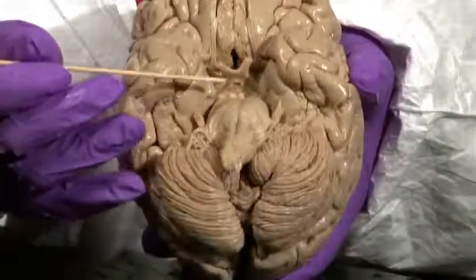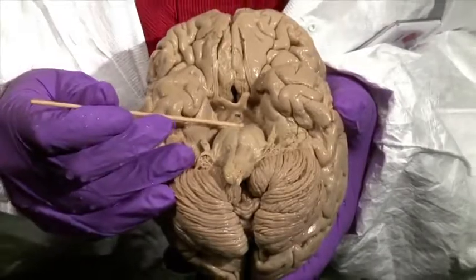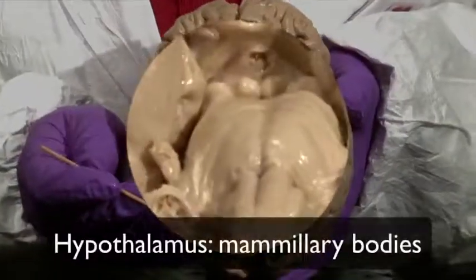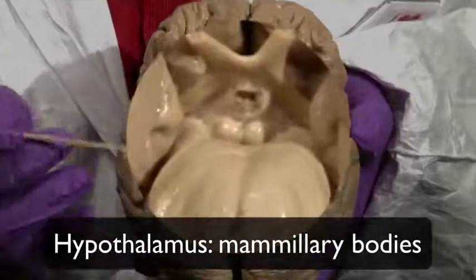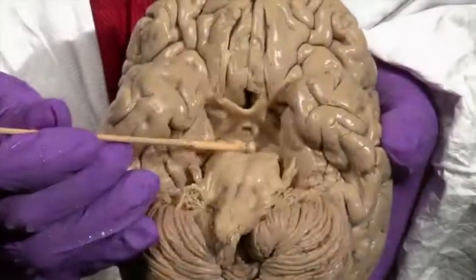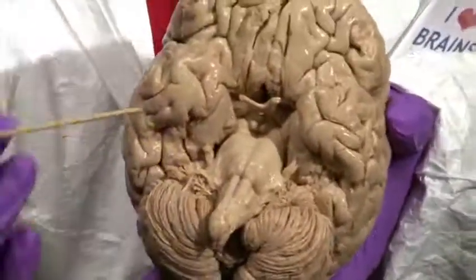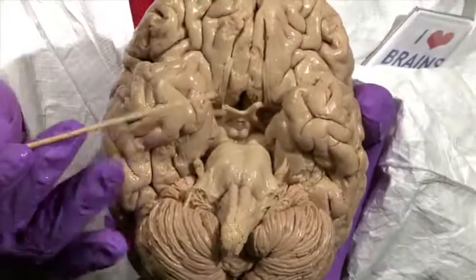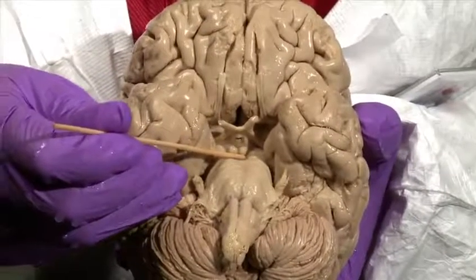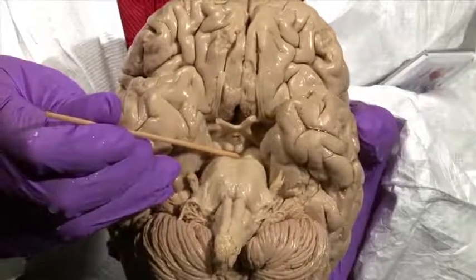Just behind the stalk of the pituitary are two bumps that define the posterior limit of the hypothalamus. Those are called the mammillary bodies, which are seen right here. Now, if I tilt this specimen a little bit more, you can appreciate a dark space just behind these mammillary bodies. And this is roughly the junction of the diencephalon and the midbrain.